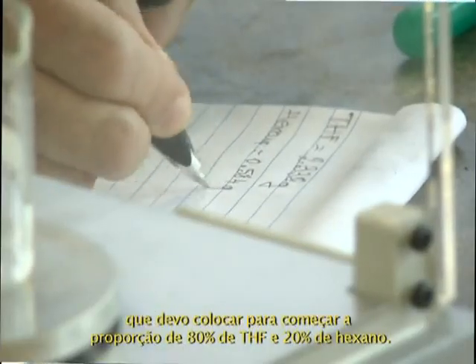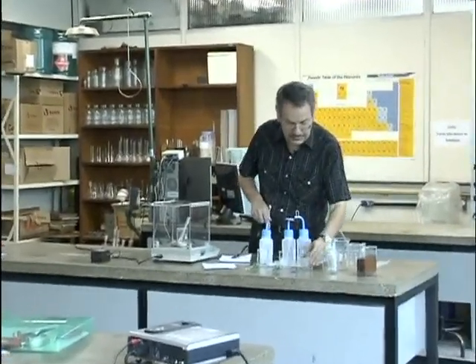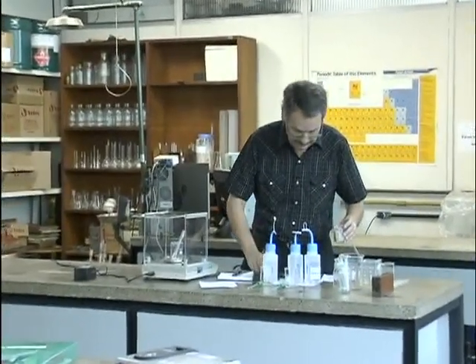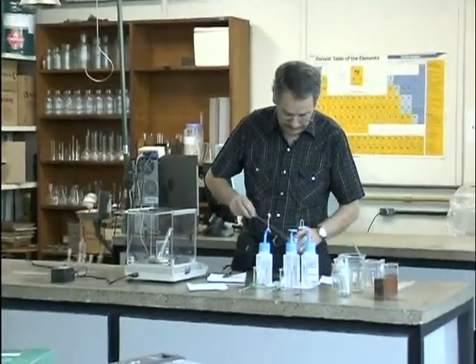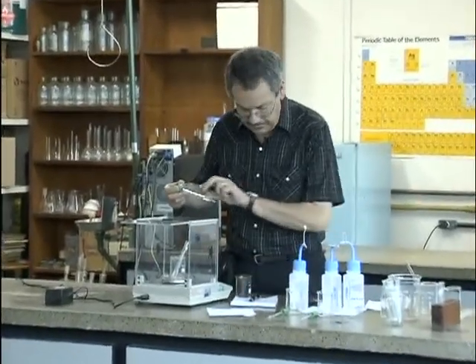Look where I put the hexane. This is it. Yes, this is it. No, there is enough remaining. 0.584.